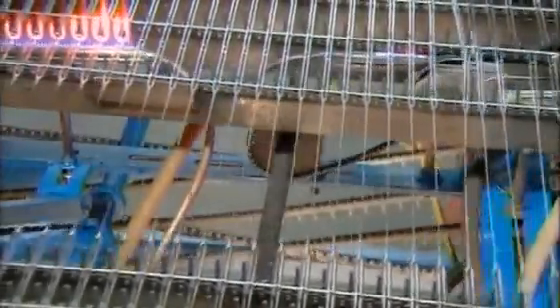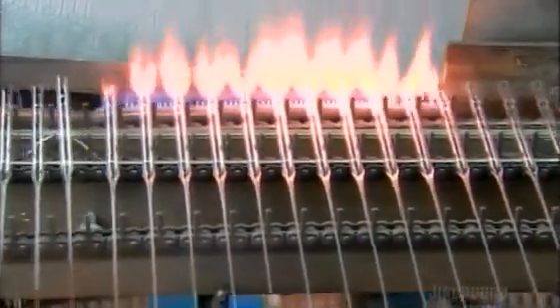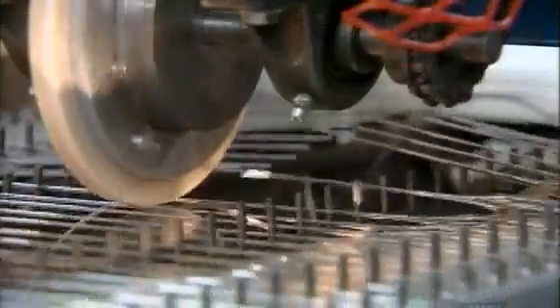Now for the other end of the pipette. They cut it to length using thermal shock, and again, a glazing burner forms a glass bead along the rim. A cutting wheel slices through the tip end, creating 2 tubes of identical length.